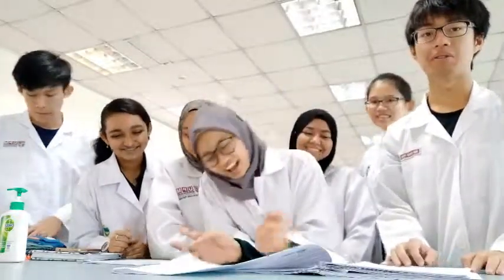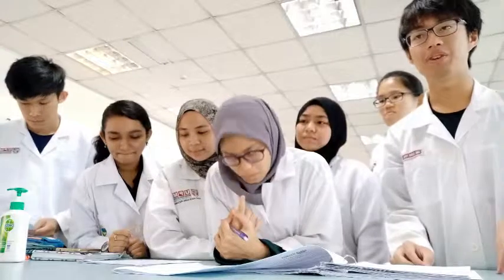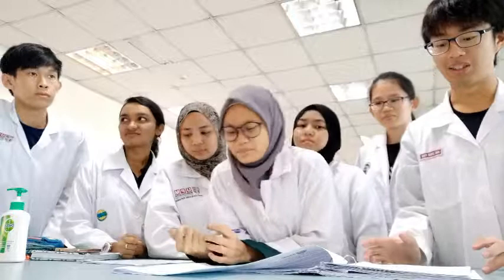So for this test, we are using the concept of the Benedict test, where the test is used to test for reducing sugar in the urine. If the reducing sugar, which is glucose, is present in the urine, then the test will be positive. This is because the glucose will reduce the copper 2 ions to copper 1 ion, which will cause the solution to turn brick red or light green when it's tested.